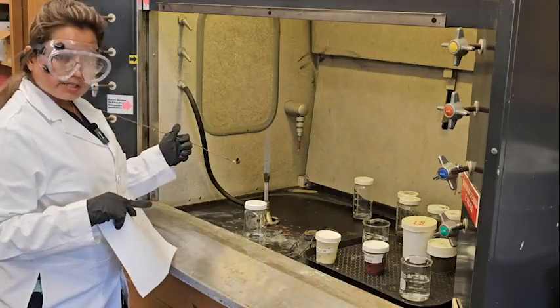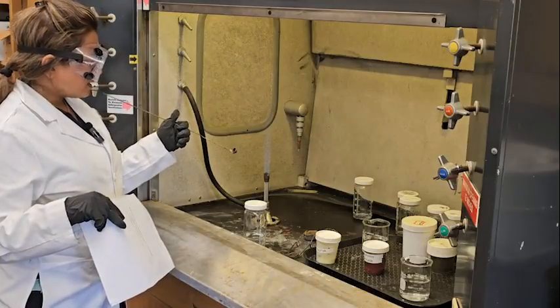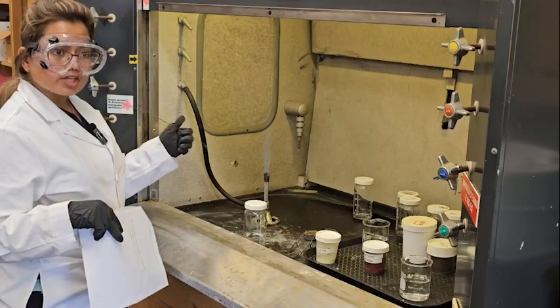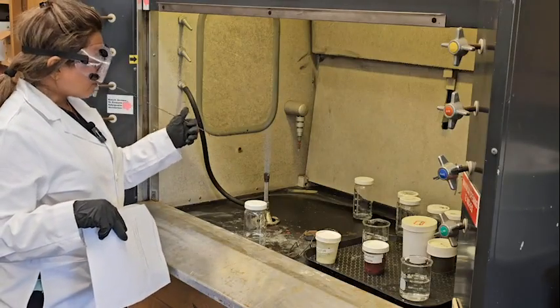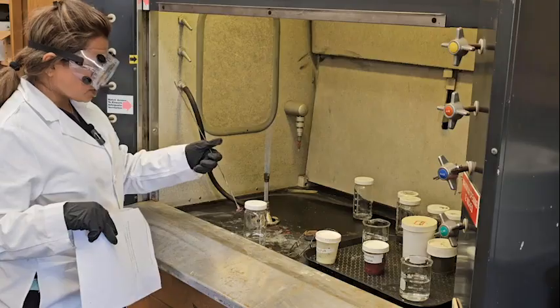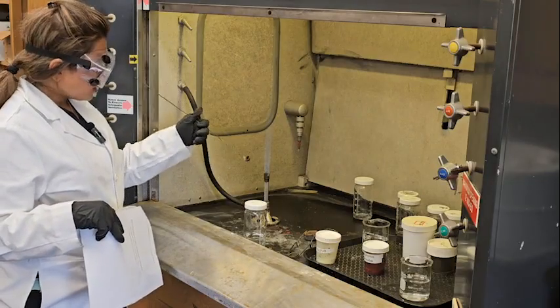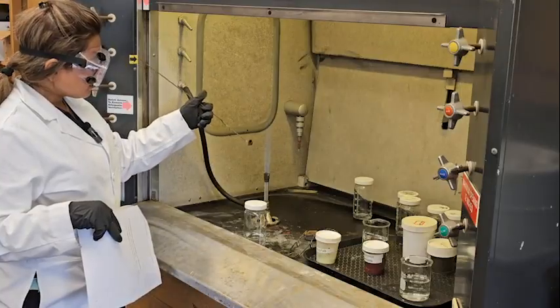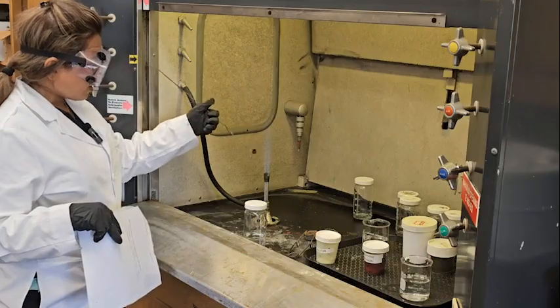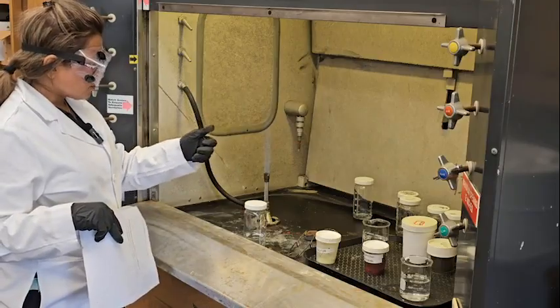We will burn it, and after we burn it, we will check the flame changes. After burning it in the air, and when we contact it with the oxygen we collected in part 2, we check the flame color.